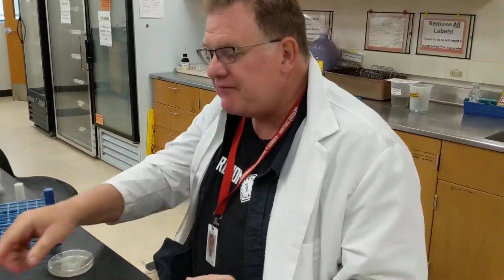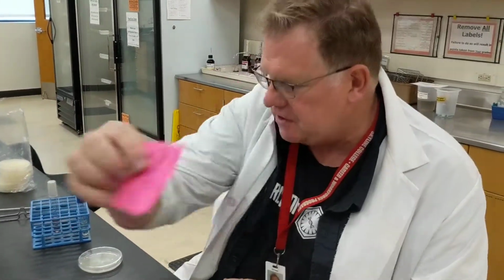Janar is on the video. What we're going to do today is show you a little bit of what's going on with lab number 7 and lab number 8. Number 7 is looking at the effects of oxygen, okay?